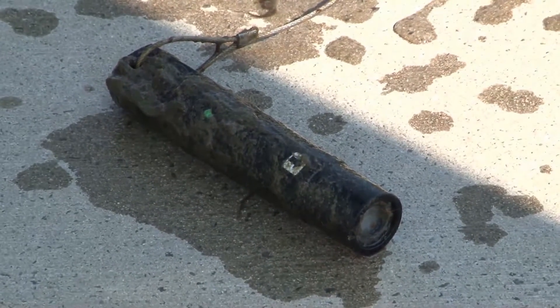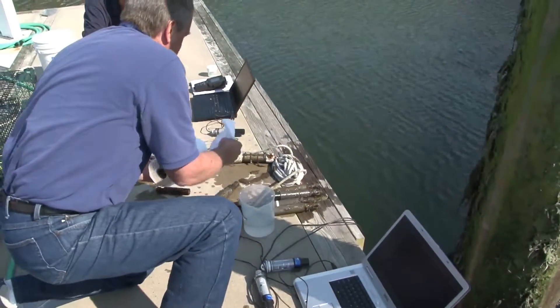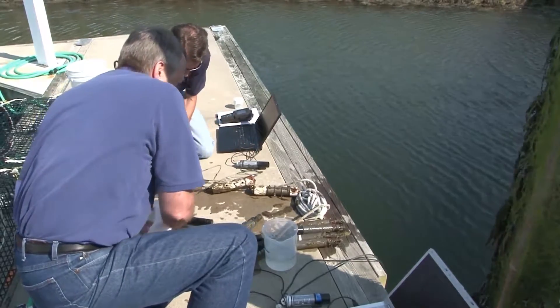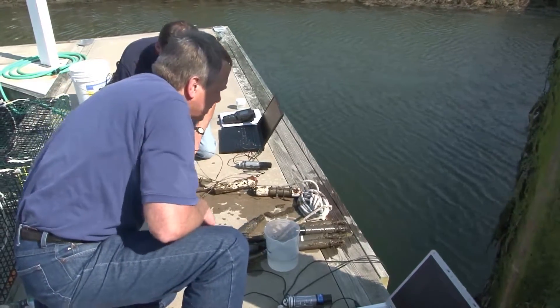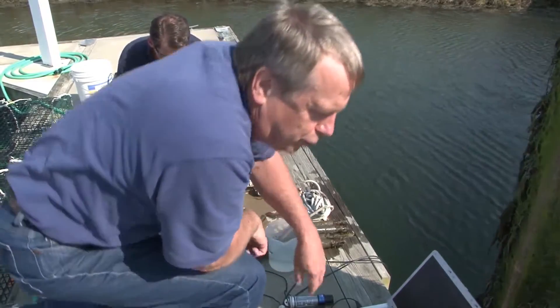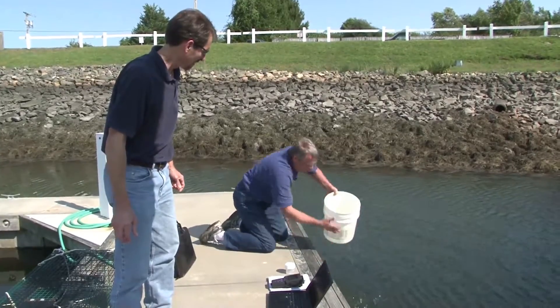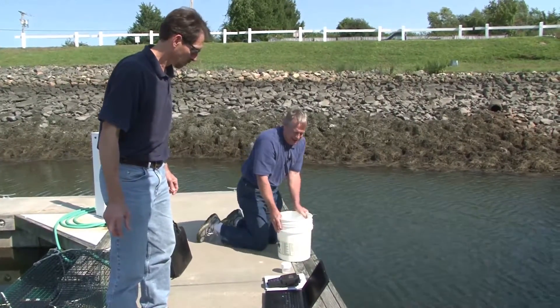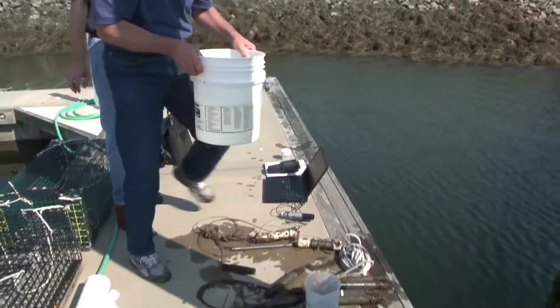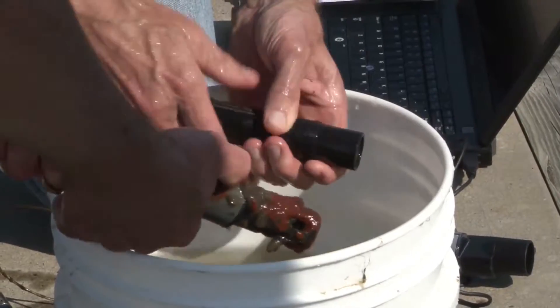Next, we clean the loggers. They're so messy it might be good to rinse them in a bucket of water first to get some clean water on them. That'll help us clean them off a little bit. Then I have fresh water for the second round. It's quite extensive fouling.